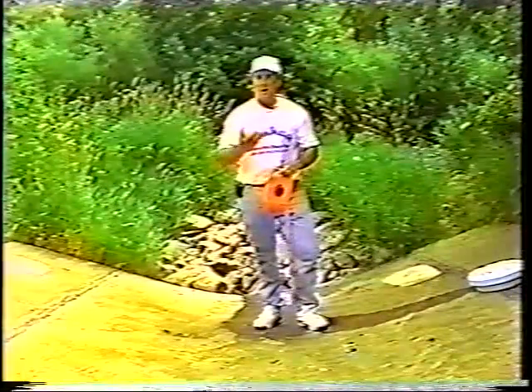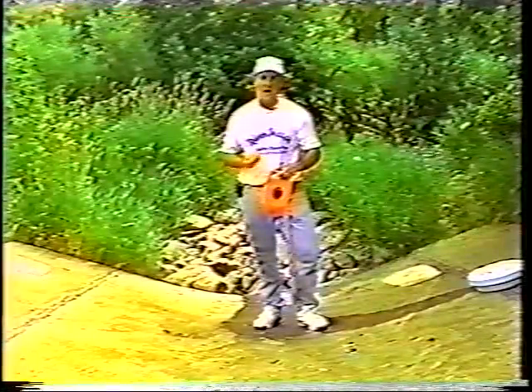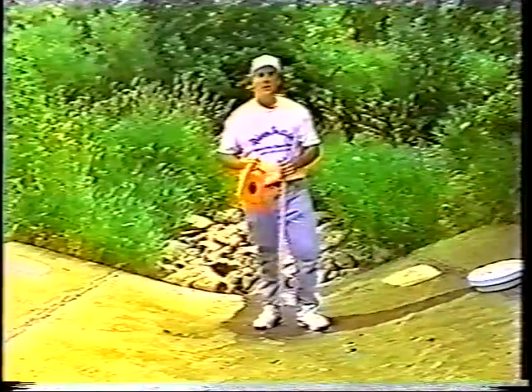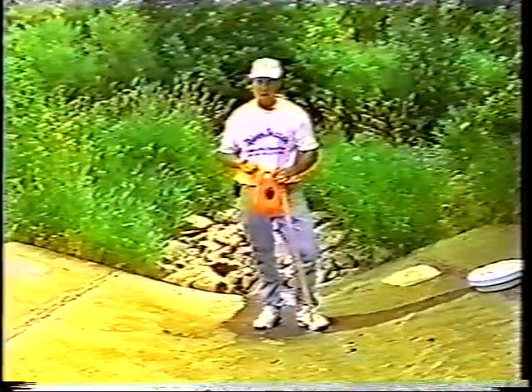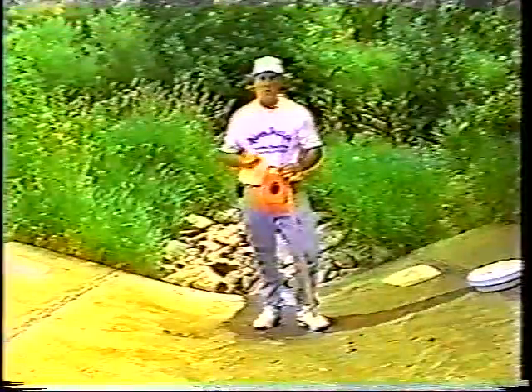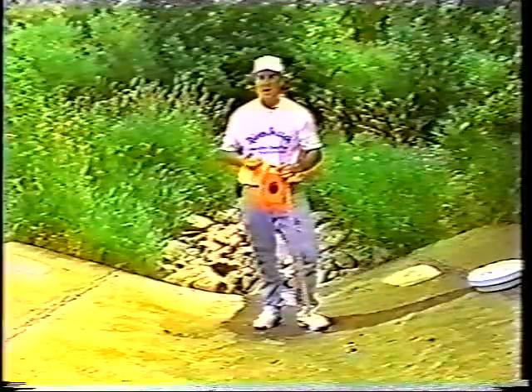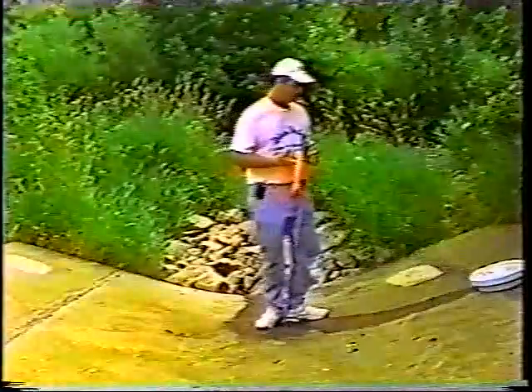And in order to do that, what you'll have to do is time an orange over a distance of 100 feet to determine how fast the current is traveling. And also look at the average depth of the river to determine how much water is flowing by a given point of time. So those are the 3 tests that you're going to be running when you collect your information in temperature, pH, and current. And now let's go down to the river and collect that data.